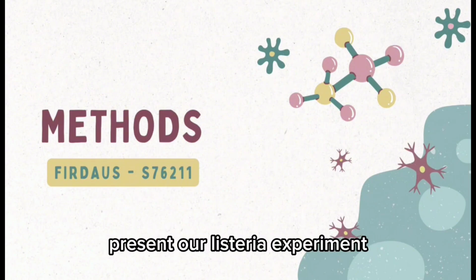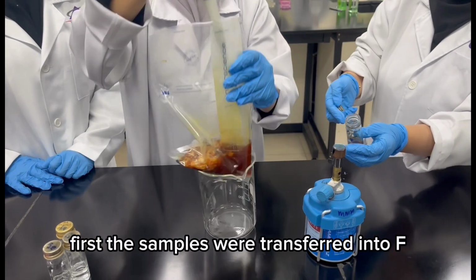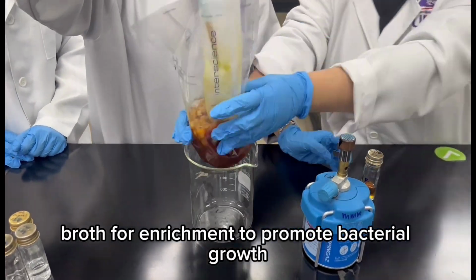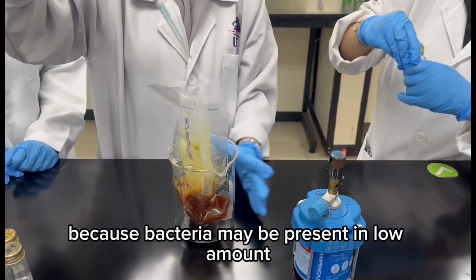So today, I will talk about the method. This video presents our Listeria experiment using raw chicken and meat as the sample. First, the samples were transferred into Fraser broth for enrichment to promote bacterial growth before further analysis. This step is important because bacteria may be present in low amounts in the food samples.